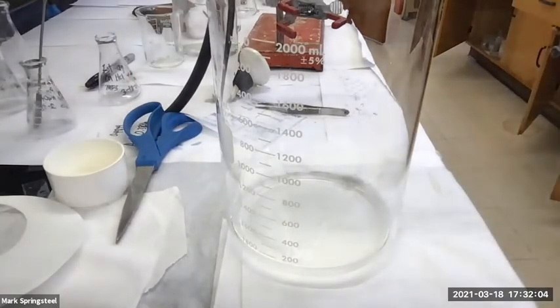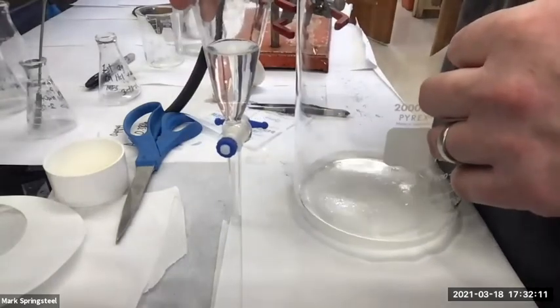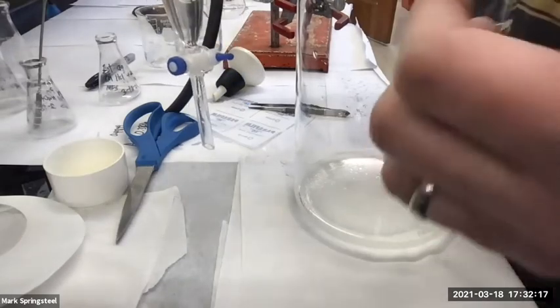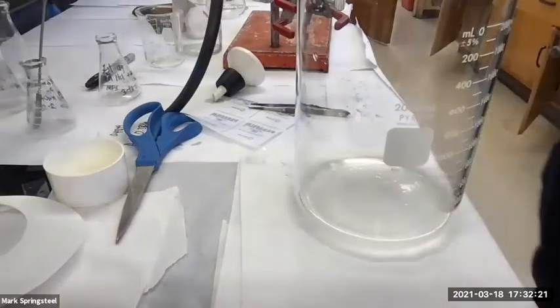And then this was my other aqueous layer. So remember what this layer was? This was the last aqueous layer. We added, no, this is the organic layer, huh? Never mind, this is the organic layer. So this doesn't need to be quenched. The organic layer doesn't really get acidic or basic. This will go straight into the waste container. I'll go pour that now.